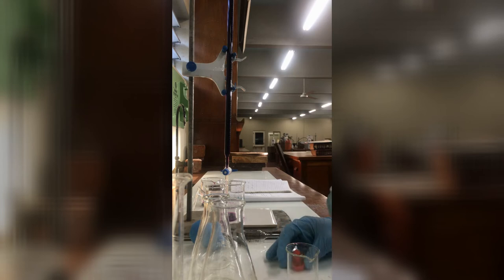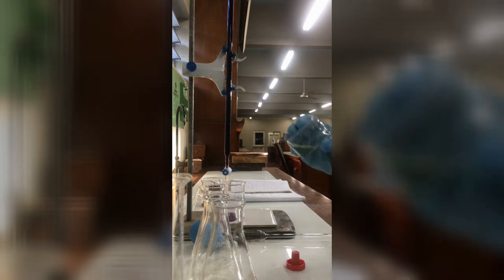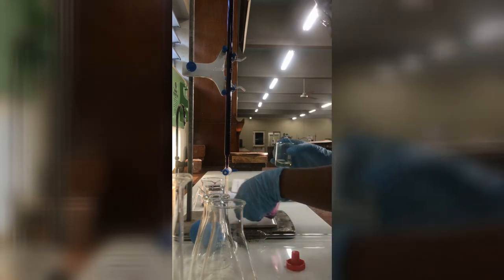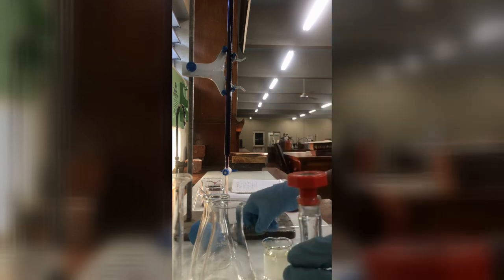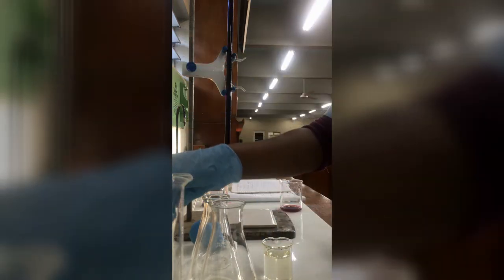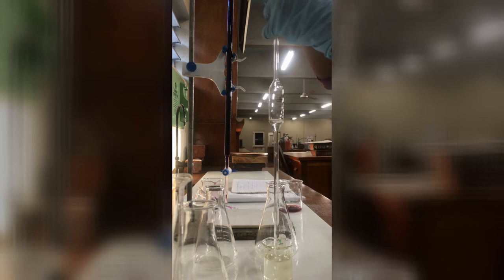So now we are pouring our iron(II) solution in a beaker, but first we need to condition our beaker. We must pipette 25 mL of 0.01 molar iron(II) sulfate solution into a conical flask.